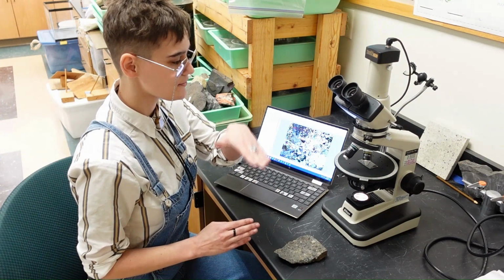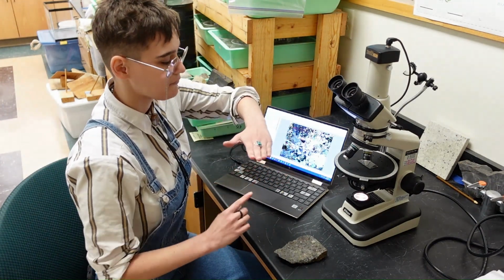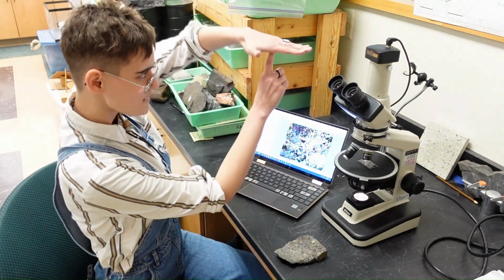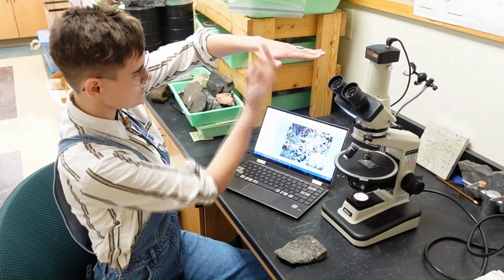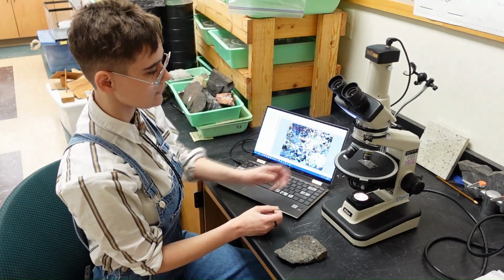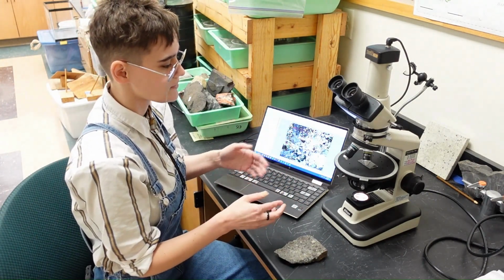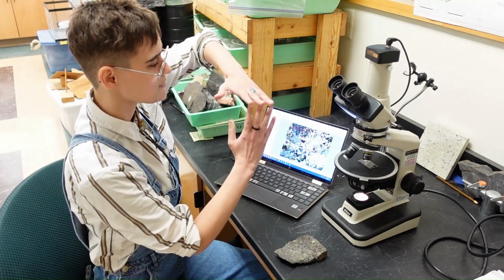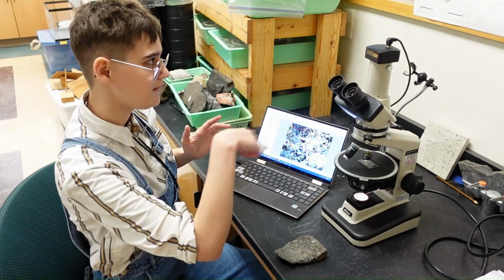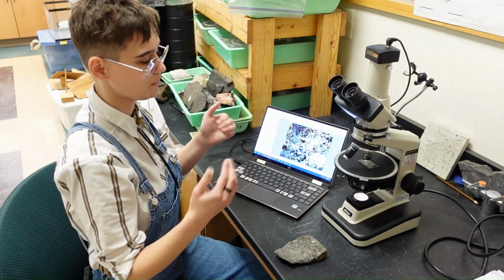And when it enters something that is not air or vacuum, it refracts. So light entering something like this can suddenly, as it goes through, kind of shoot off in another direction, depending on what you're shining light through. And the polarizer essentially forces light in only a certain orientation to go through.